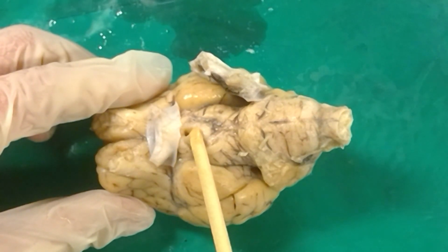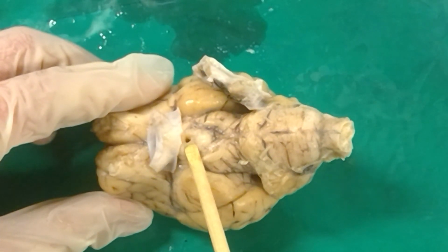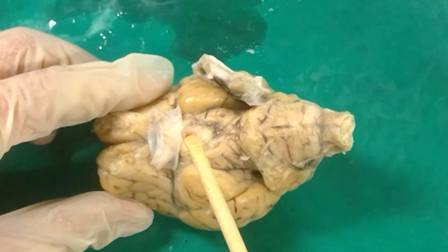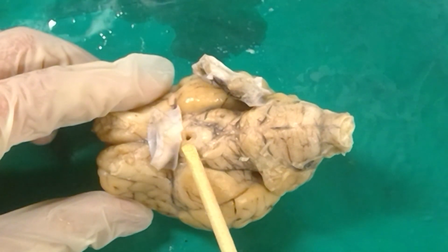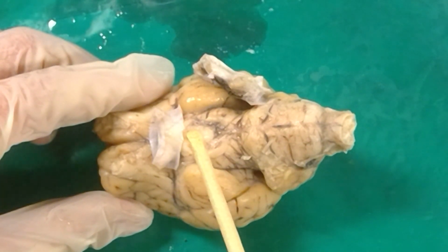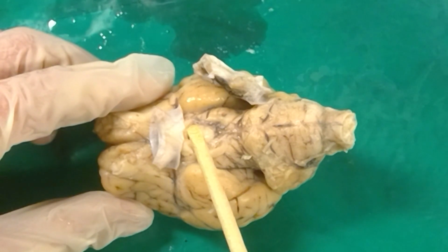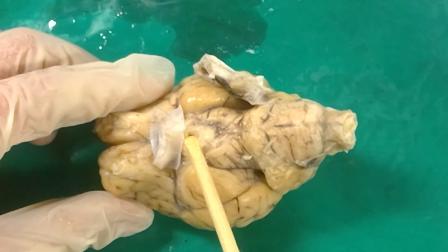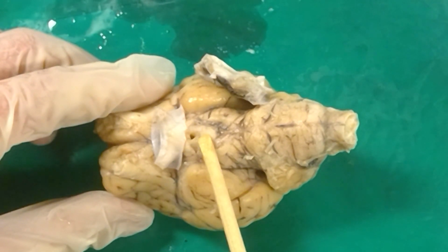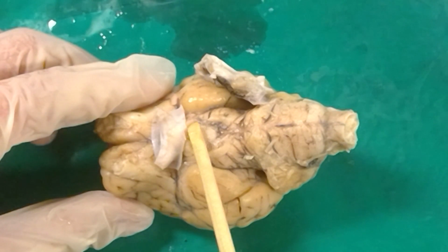Just caudal to that, we can see there's this hole. If you weren't able to see the hole instead of black stuff covering over this, that's likely to be the infundibulum, which is a stalk that attaches the pituitary gland, which would be sitting out here somewhere. Not technically part of the brain, but attached to it via the infundibulum, which in turn is attached to the brain by a ring of tissue surrounding this hole, known as the median eminence. The median eminence is the tissue surrounding this hole.